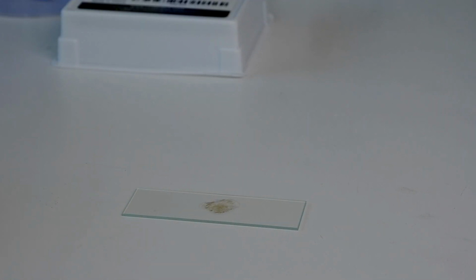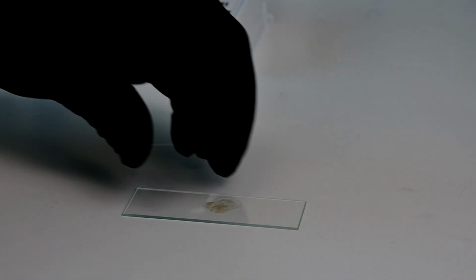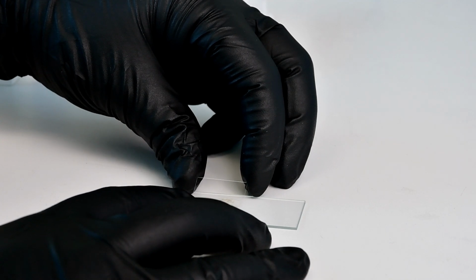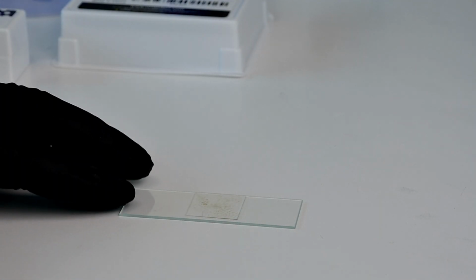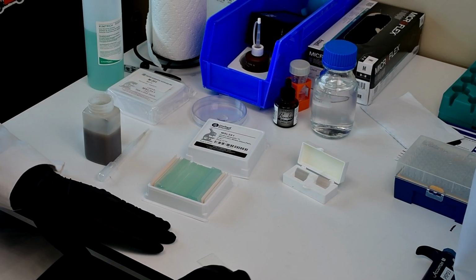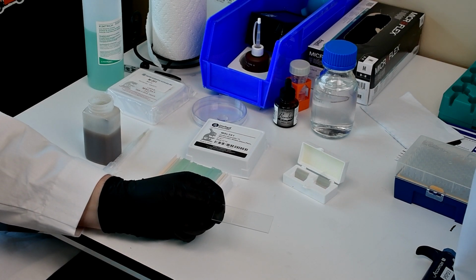I'm going to grab my cover slip. Make sure I only get one. These are very thin, and so it can be easy to grab multiples. And what I'm going to do is hold my cover slip on a slant so it covers the drop that I placed on the microscope slide. I'm just going to drop it in place, just like that. And now I have my prepped slide that I can place into my microscope, and I can look at this under the microscope.